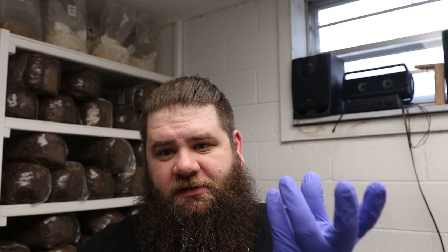Now that we're done with the pour, let's talk about the usefulness of each one of these containers. The petri dish is a great wide surface so you've got plenty of surface area for mycelium to grow across. As it grows across, you're able to take a chunk from anywhere that's clean - which is another reason why petri dishes are good. You can see contamination growing on them easily. You can sector out by cutting out a small chunk in your flow hood and transferring it to another petri dish, a jar of grain, a bag of grain, or anything else you need.